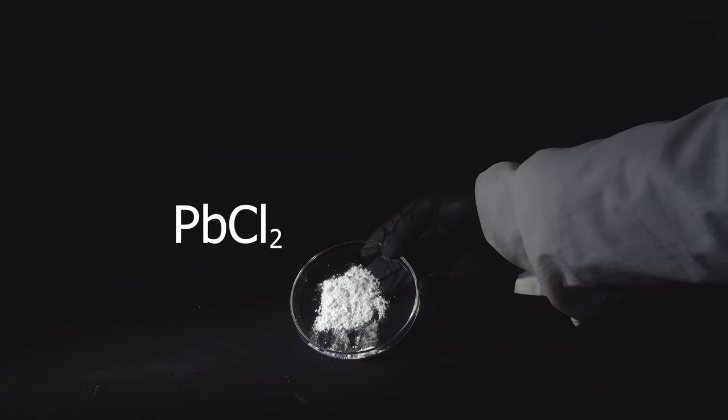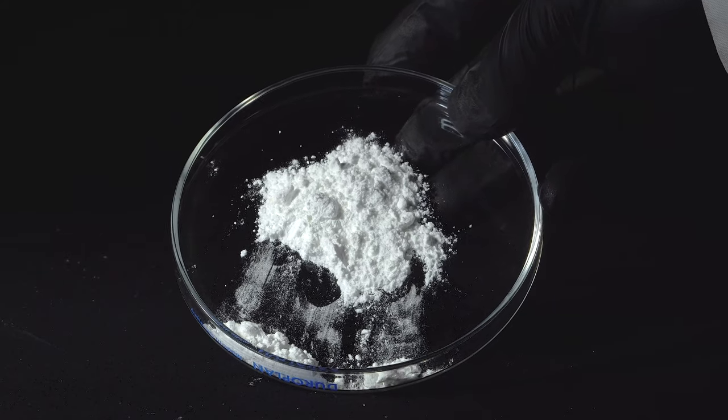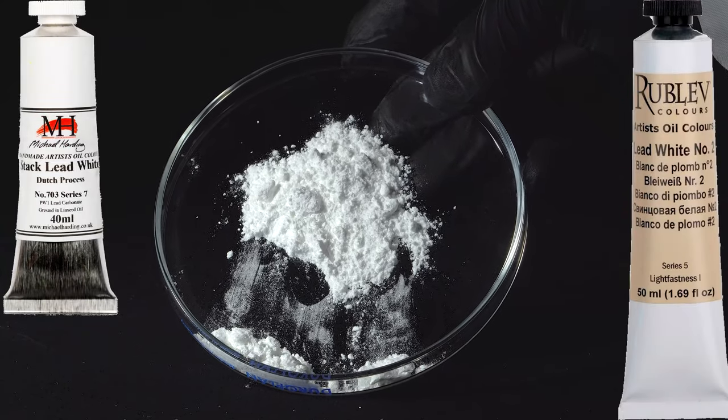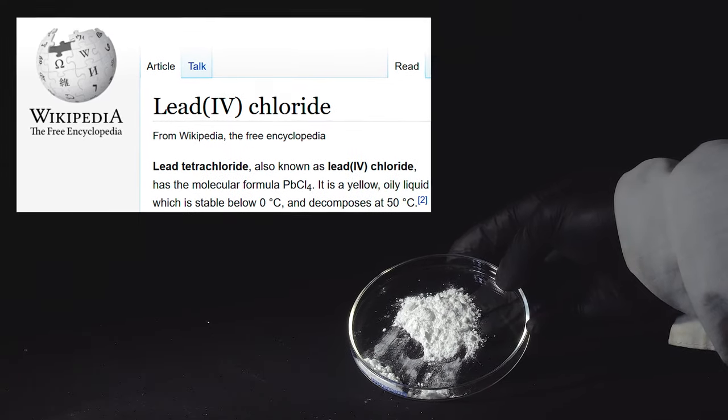Hey guys! You all know about such thing as lead dichloride, which is a white powder used in manufacturing of some types of white paint. However, there is also lead tetrachloride that I'm going to talk about in this video.